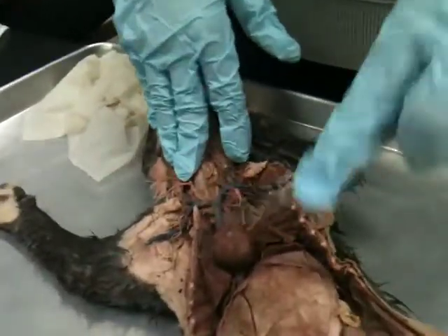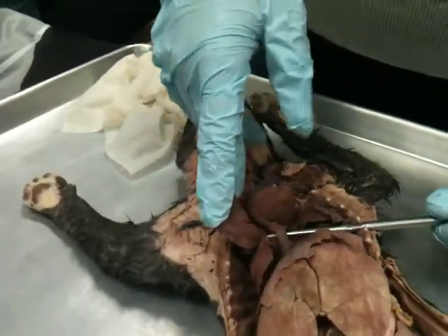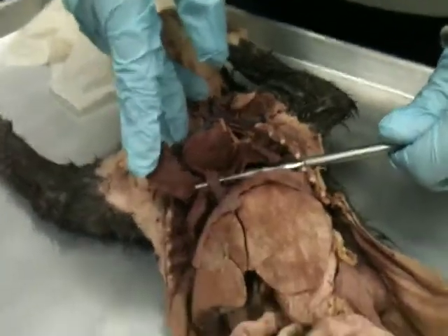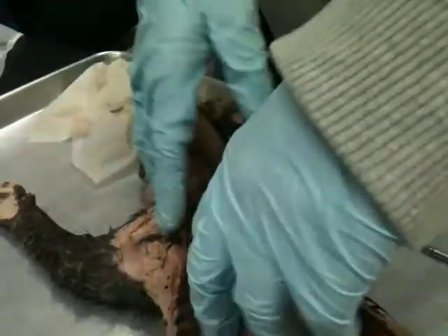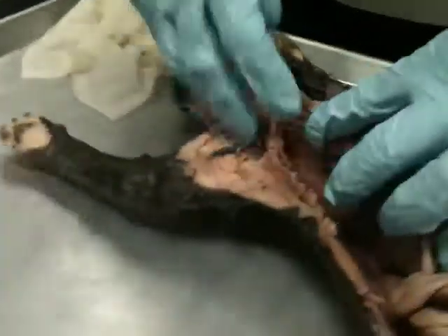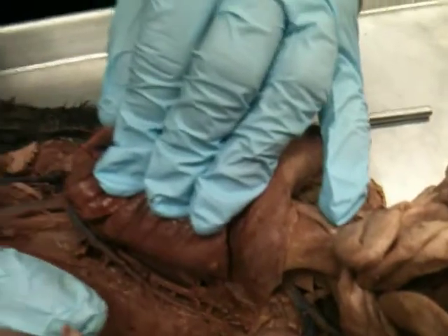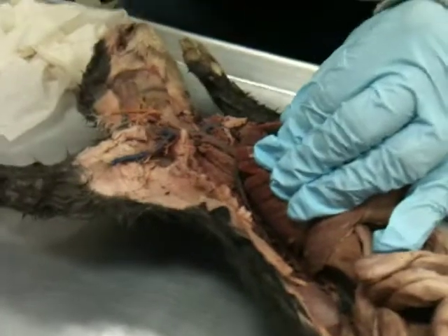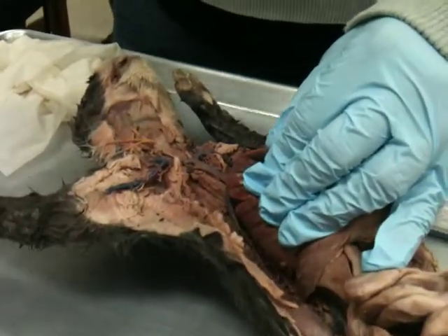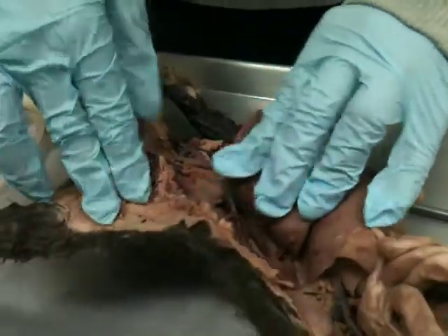Yeah. Okay. Then here we have that lower branch coming out of the right atria. Inferior vena cava. Inferior vena cava. Okay, and then we have that one weird unpaired vein that we're learning in the venous system. So it's on the right side. It branches off of the superior vena cava. See it right there? And it runs down. So that's the what? It means not paired. Azygous. Azygous. Yeah. A means not or un, and zygous means pair. So the unpaired vein is right here.